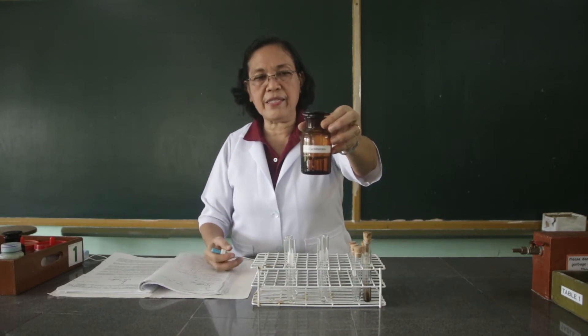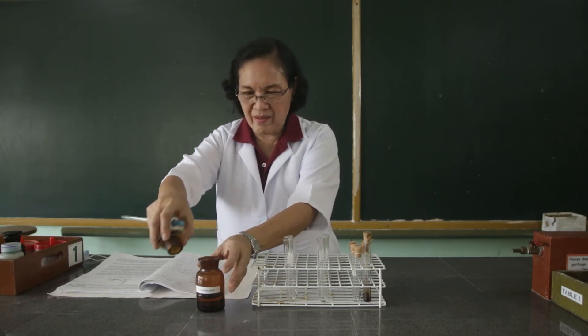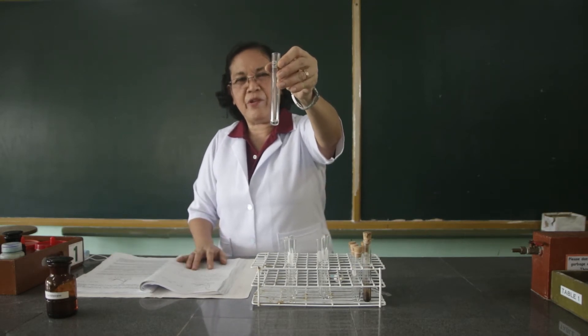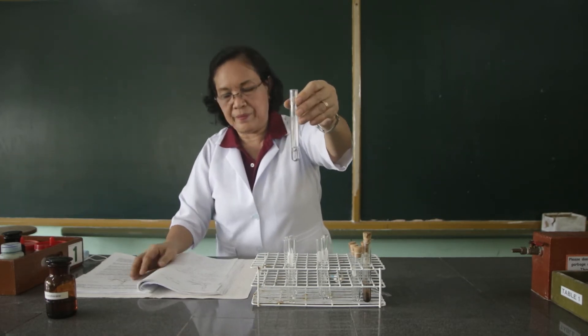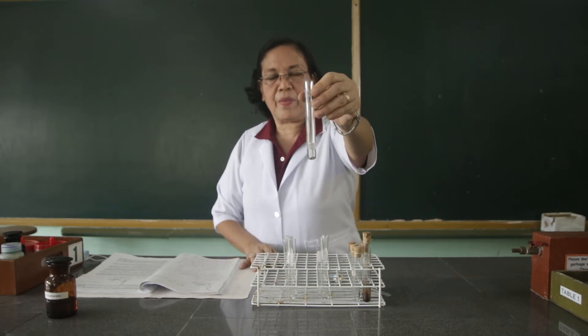The next test that we are going to apply to the hydrocarbons is the solubility test and the density test. The hydrocarbons that we are going to use are the cyclohexane, the cyclohexene, and the acetylene. We are going to use first the cyclohexane — I'm going to use six drops of the cyclohexane — and add 3 ml of water. Because we are testing for the solubility of the cyclohexane, we are going to shake it to see whether it is soluble in water.